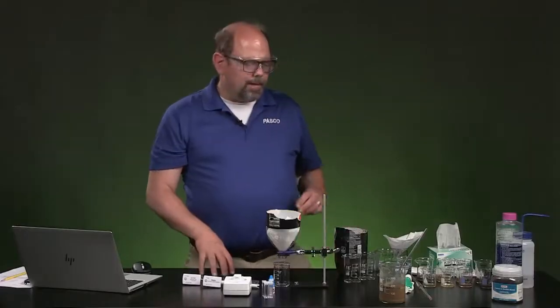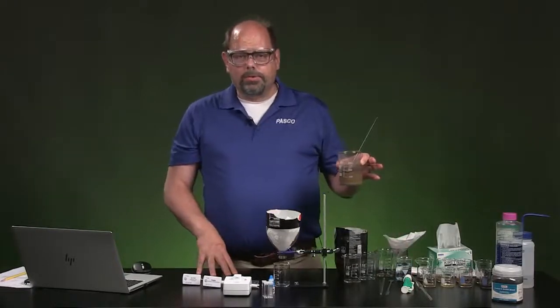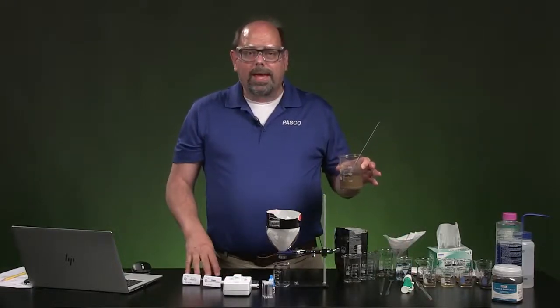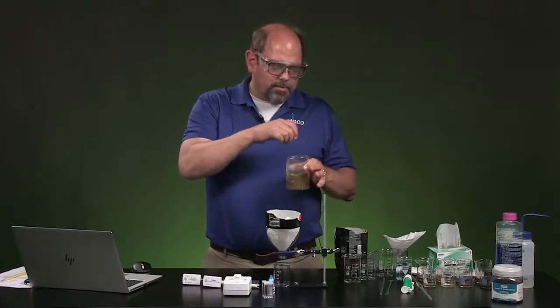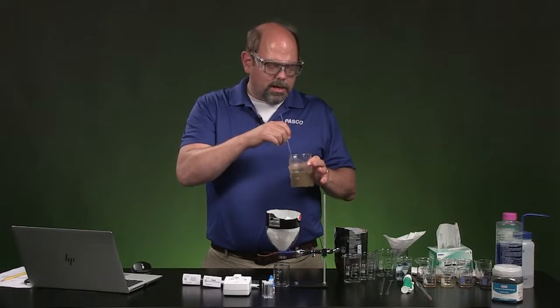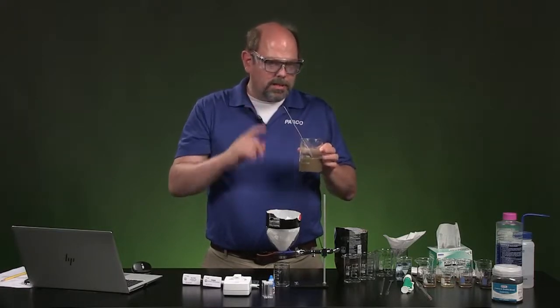To get started in the lab and to study what we want, first you're going to need a great source of water. Now, if your local stream is too far away, you can make some water yourself. Your teacher should be able to supply that. Maybe throw in a handful of dirt that would typically be in there. Make sure there's a little bit of clay so that it stays in suspension, which makes it a little more tricky to pull out.